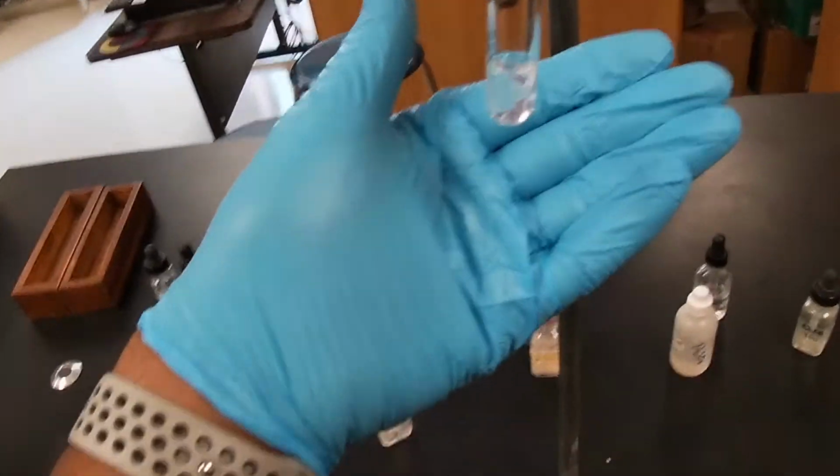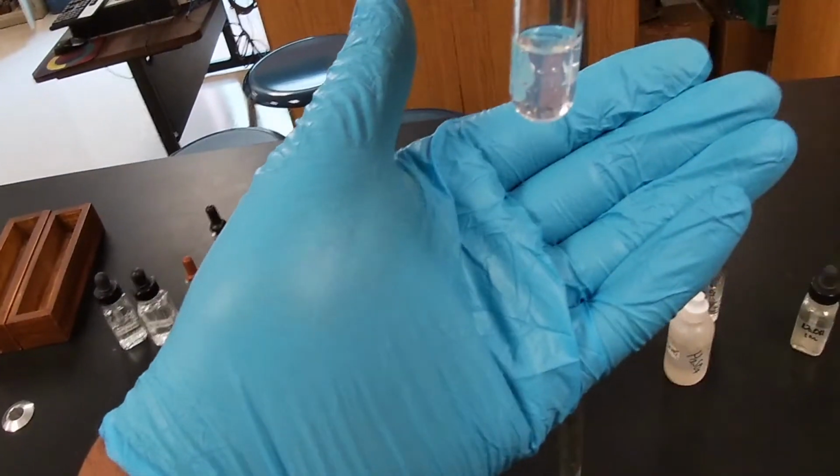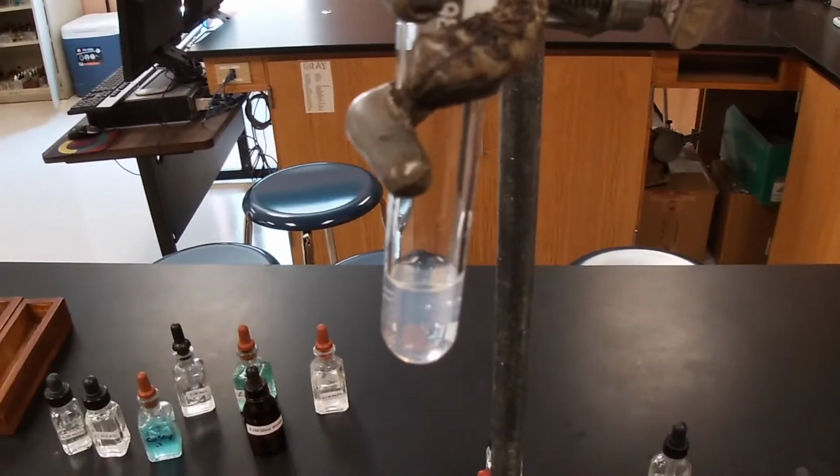And as you can see, whoops, I had to shift forward. I can tell you that it smells weird. Let's go ahead.